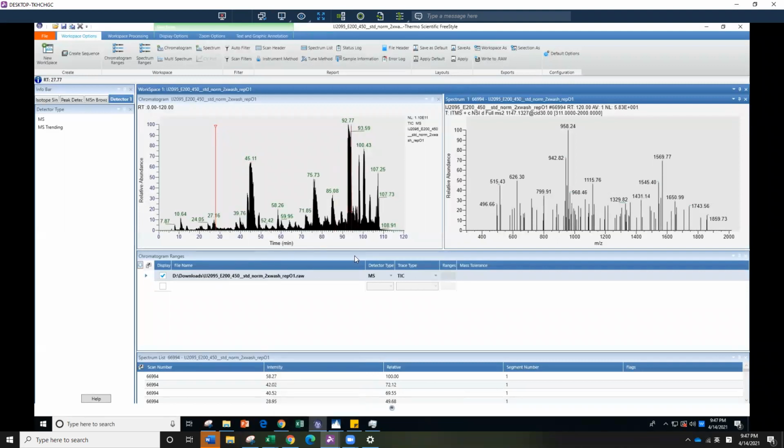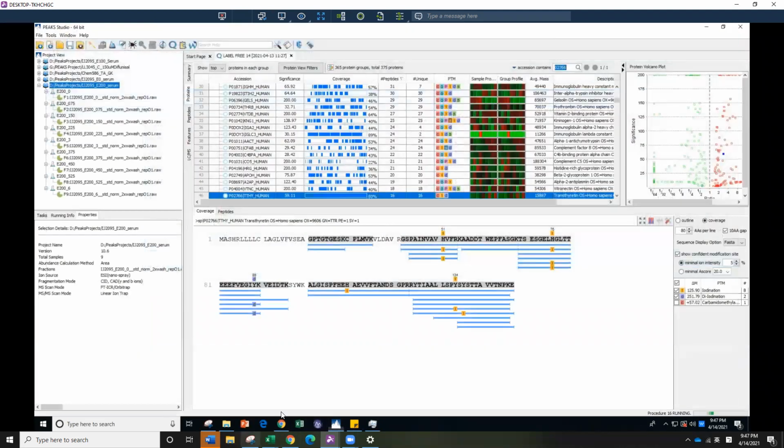So you already have your files downloaded, and you're using the Orbitrap to get your MS data. You use FreeStyle to check it. So this is FreeStyle. Let me just close this and start from the beginning. So you come into FreeStyle.